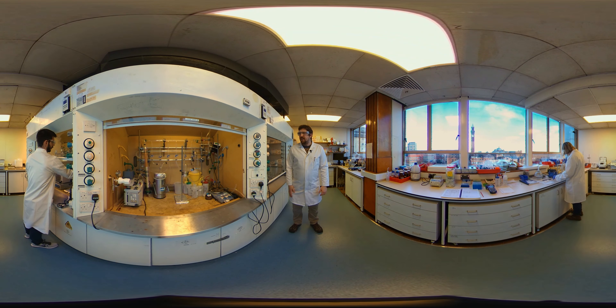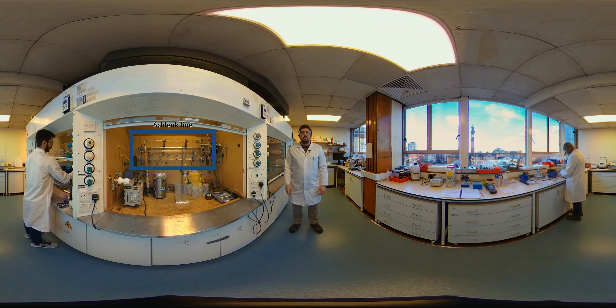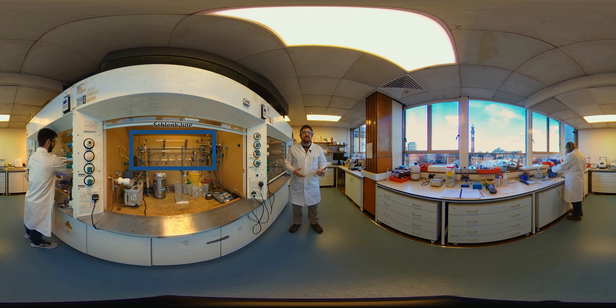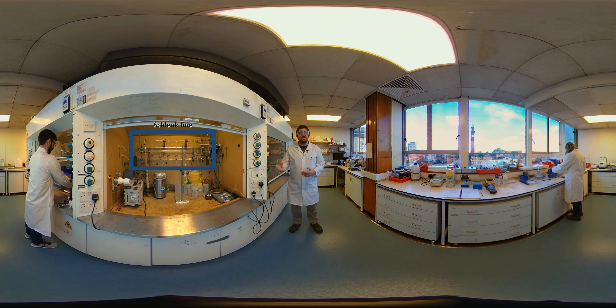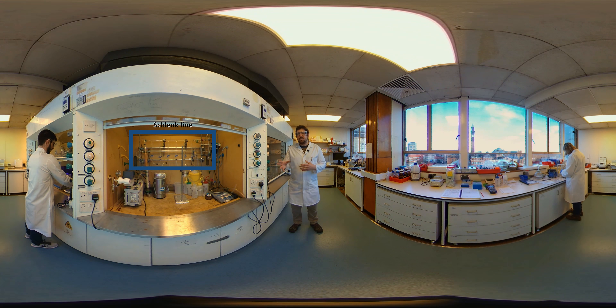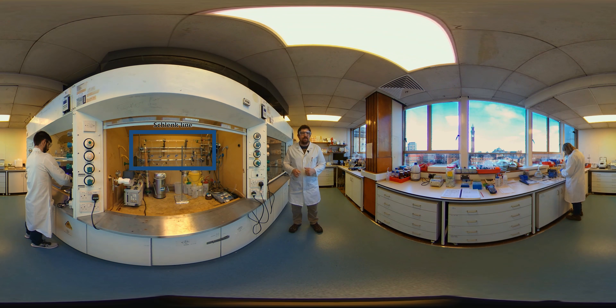For example, in this fume hood we have what's called a Schlenk line, which is an apparatus that allows us to control the atmosphere in a reaction. For example, we can remove oxygen for reactions that aren't tolerant of oxygen, or control precisely the composition of gases that are there.